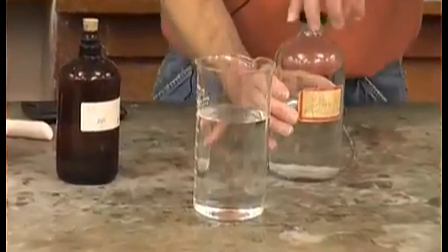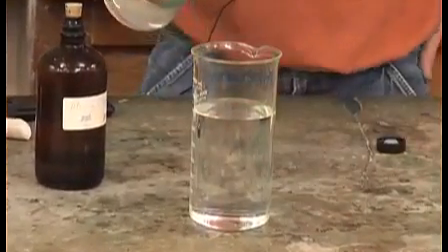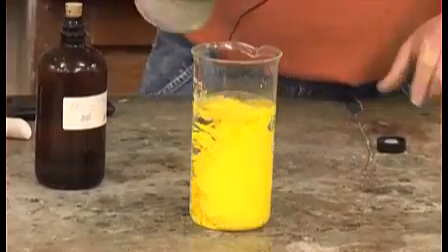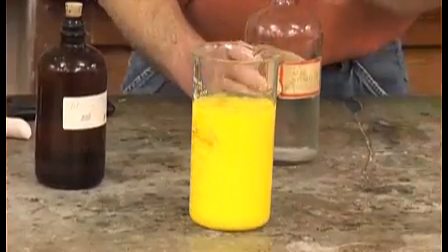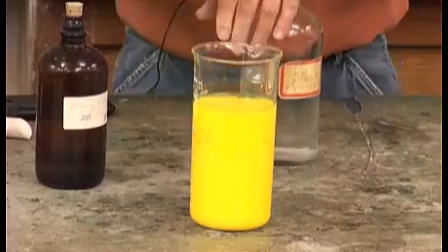I just put a little bit of that in, and watch this. This is a nice reaction. We form a solid precipitate. A yellow solid is formed.